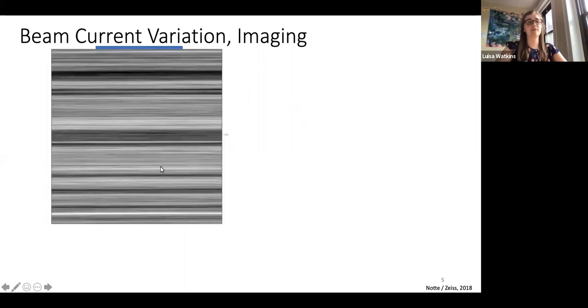This is an example, which actually goes along with my results that I'll show later. If this is the sample and it's this size, this is what the dose looks like. You see we have these horizontal stripes because we're scanning horizontally across. The lighter the stripe, the larger the value of the dose, versus the darker values, which are lower values of dose. So this is the particle beam dose, and as you see, it's changing as it goes across the sample.